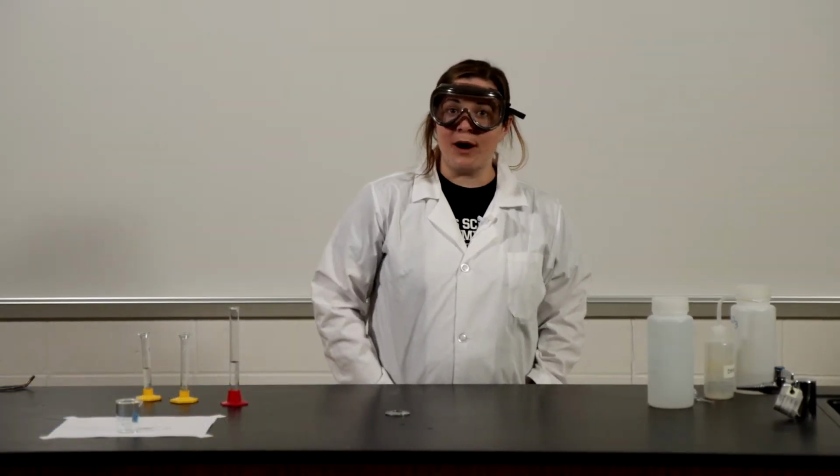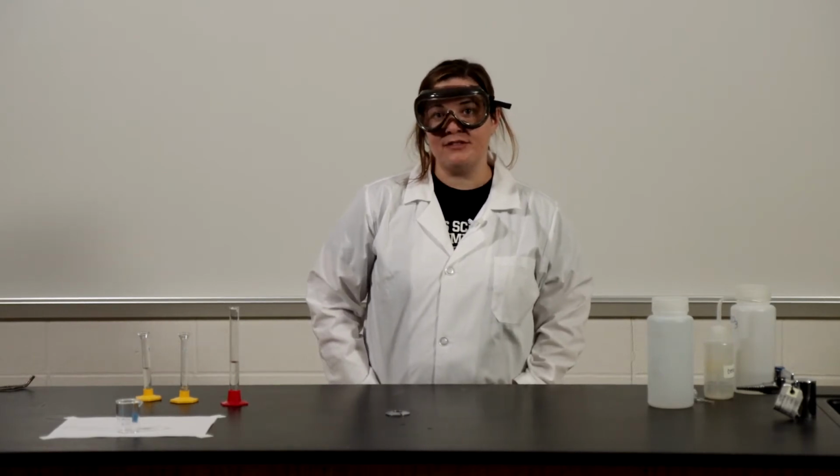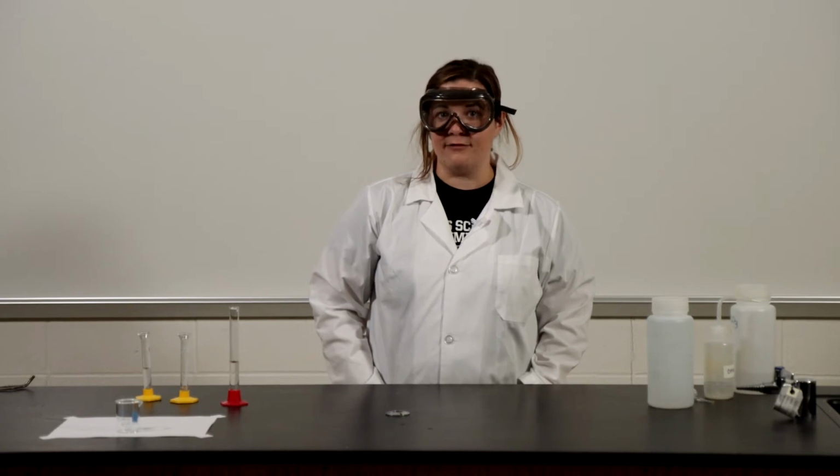Everyone, Mrs. Black here. Today we are going to do the Iodine Clock Lab. There's two parts to this lab. The first lab, we are going to test how concentration affects the rate of reaction.